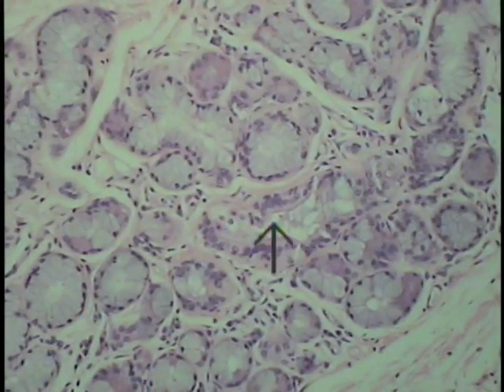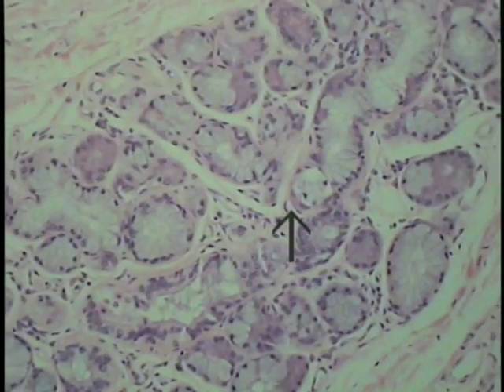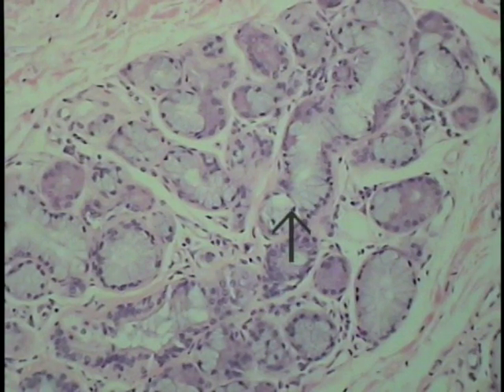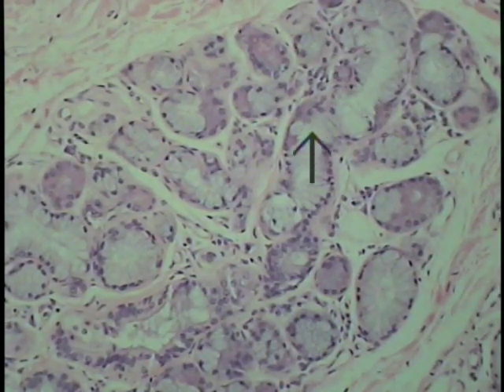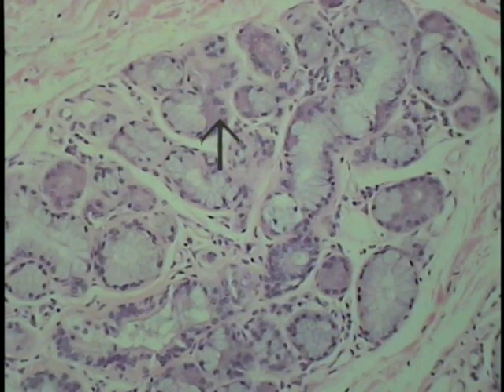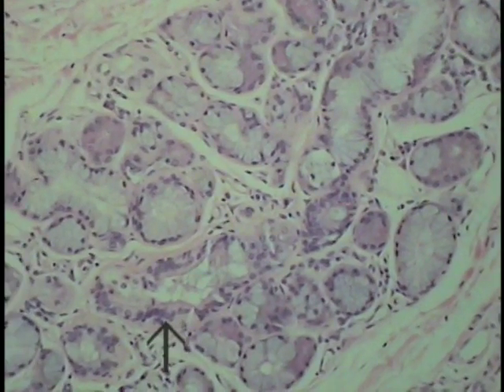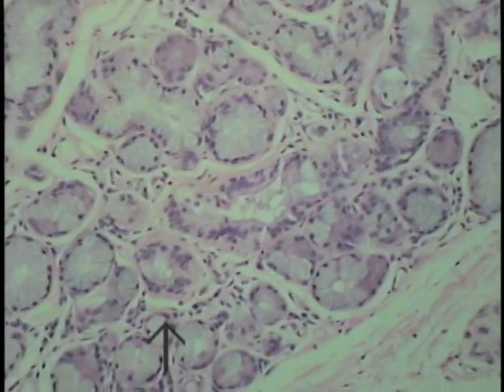The central area is one of the ductal forms that would then be coming out towards us. So if we looked at this particular section as moved here, you can see one of these mucus tubules forming the heart, more or less, of this little lobule as outlined by the arrow. Both serous demilunes here, some cross sections of mucus tubules. Well, anyway, this mucus tubule courses perhaps this way, comes through the field here, and then will eventually empty into this centrally positioned duct, which will eventually course towards and unite with the luminal surface.